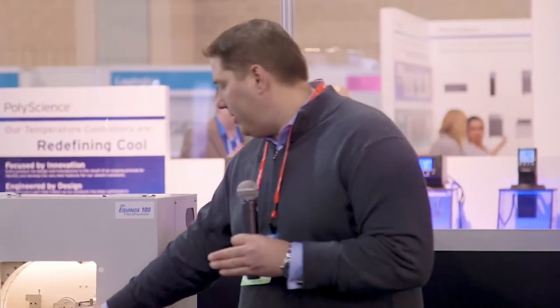So if you do still have a solid, it's going to be a surface analysis primarily, but you can actually put in a scissor jack and lift it up for larger material. So we've had parts of solar cells put in here on a scissor jack because they didn't want to destroy the product. So that's absolutely a way of doing it if you don't want to grind. Now, you may want to run the sample in different orientations, so you're seeing not just one plane of diffraction, but multiple planes. So you can turn it 90 degrees and run it that way when you are doing a non-prepped sample and can't rotate or spin it.